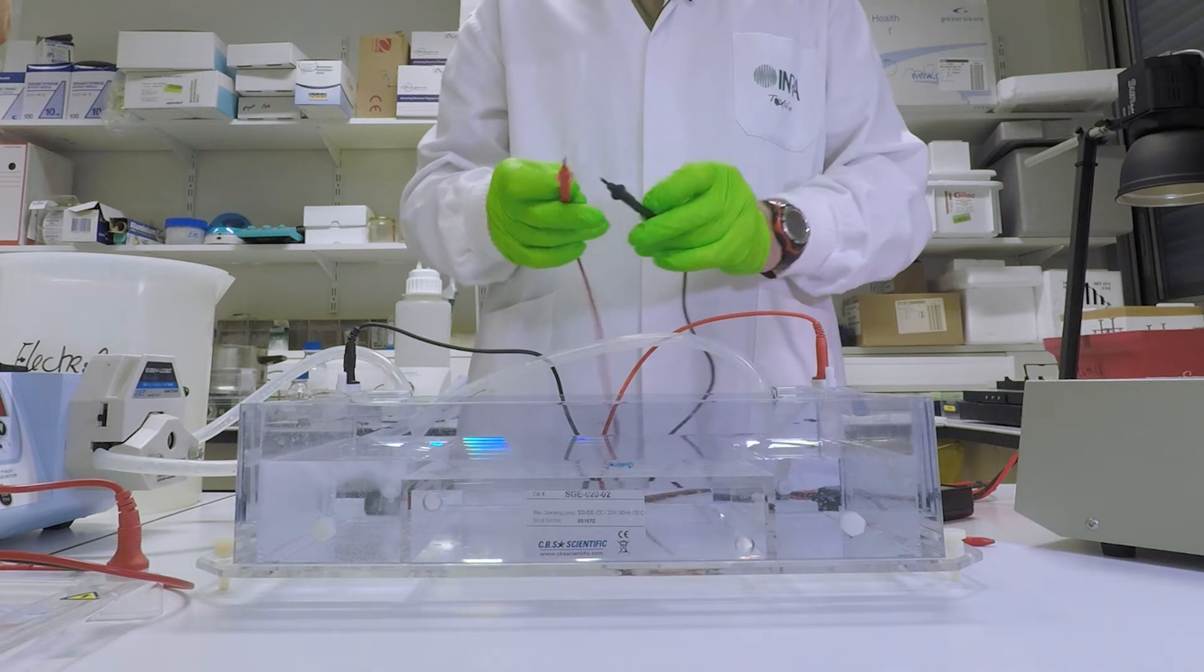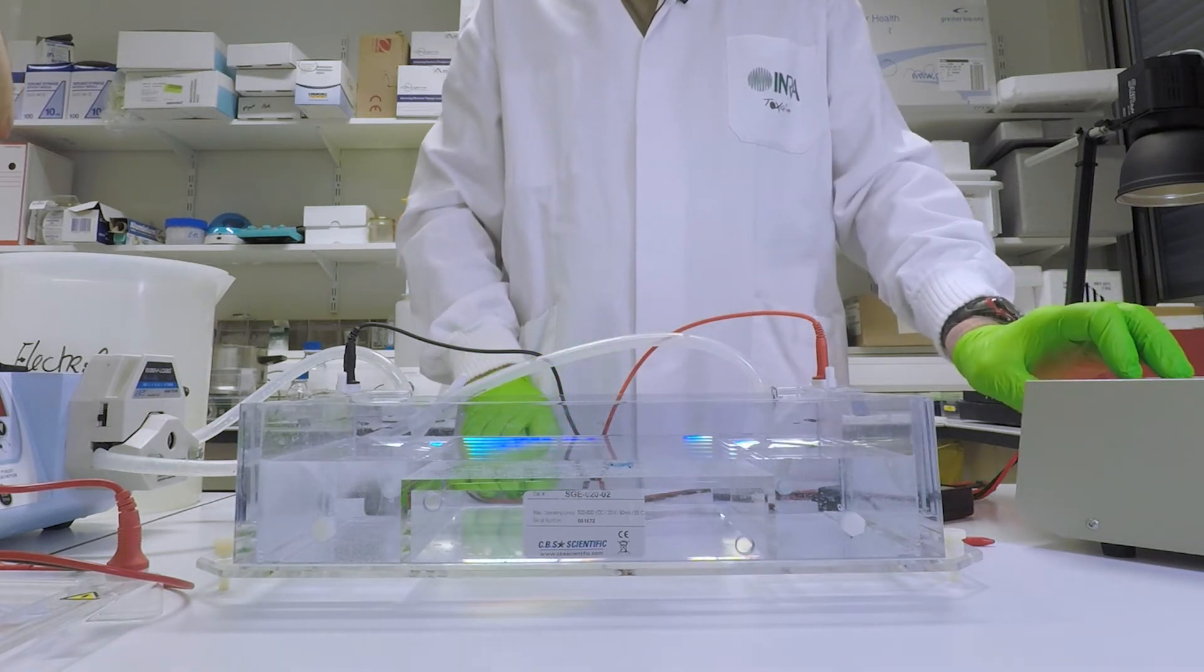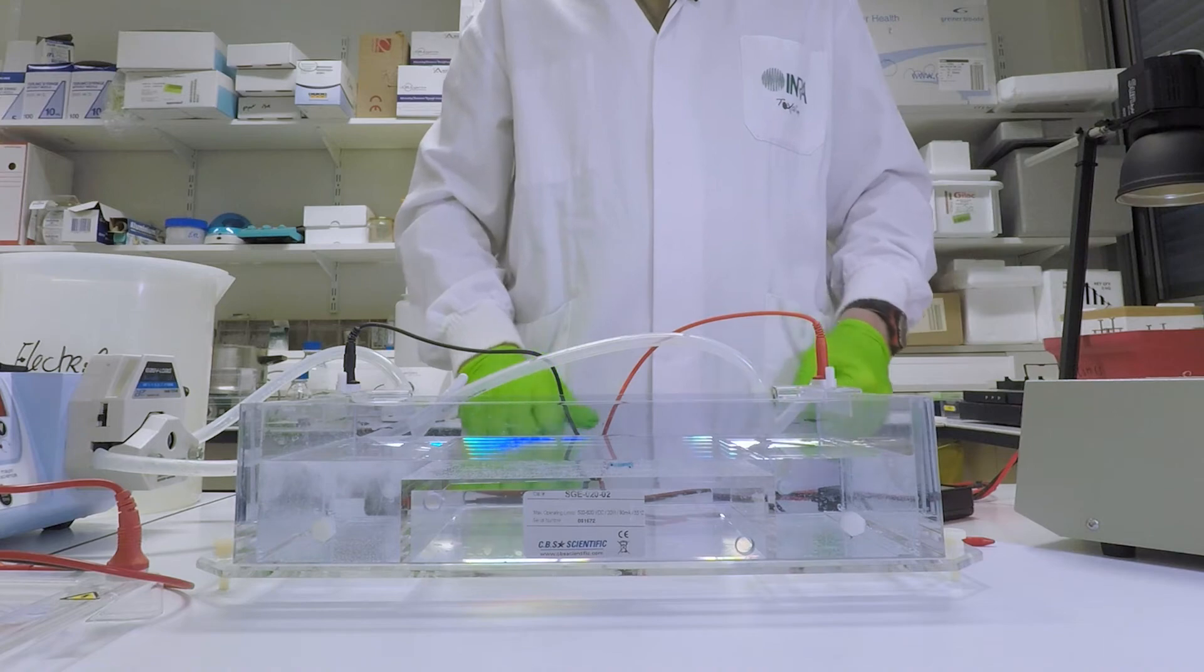So, having done that, I can again switch off the power supply. And then we can do the calculation.